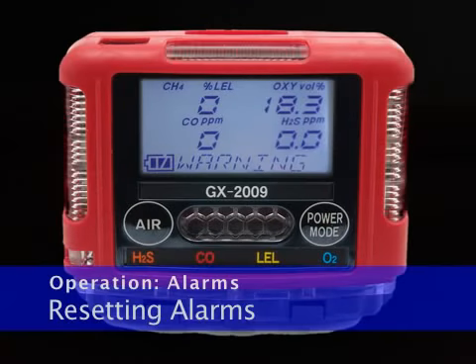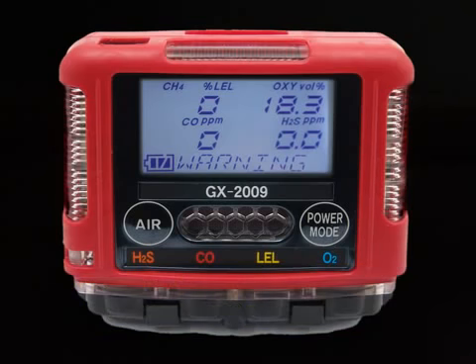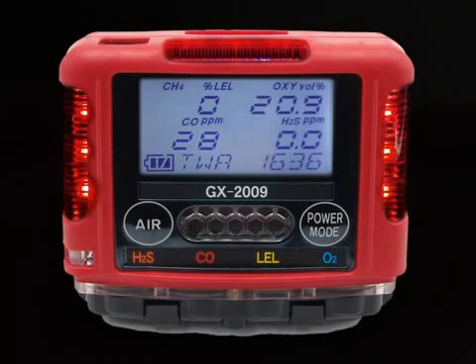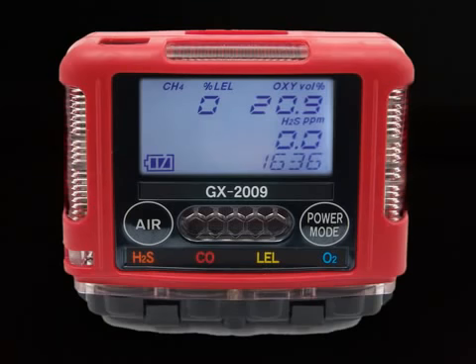To reset latch and alarms, press and release the power mode button after the gas reading falls below the alarm set point, or above for oxygen warning. If the alarms are self-resetting, then an alarm condition will automatically reset when the gas reading that caused the alarm decreases below the alarm set point, or increases above for oxygen. If a STEL or TWA alarm has been activated, it cannot be reset. You must turn off the unit to clear the alarm.